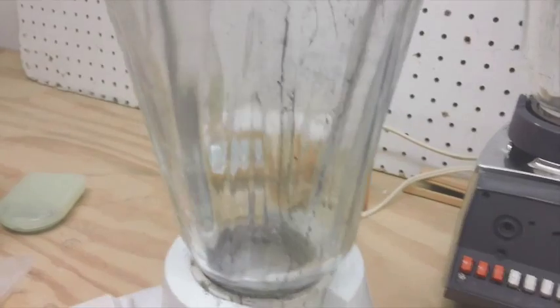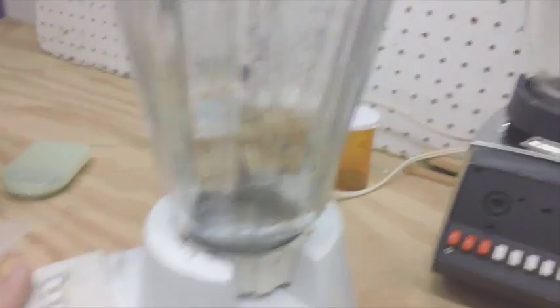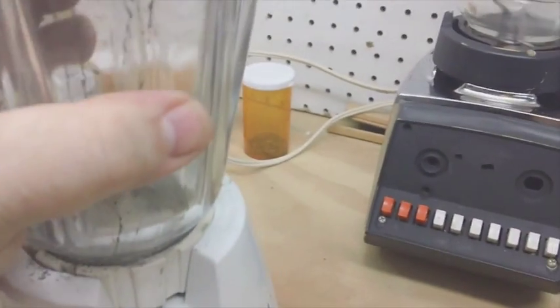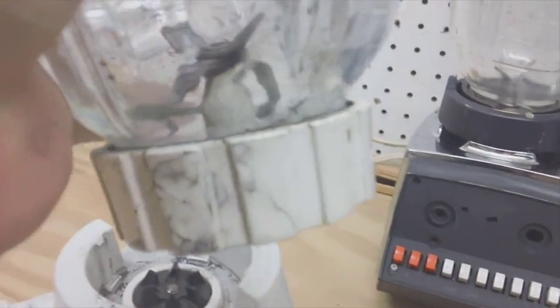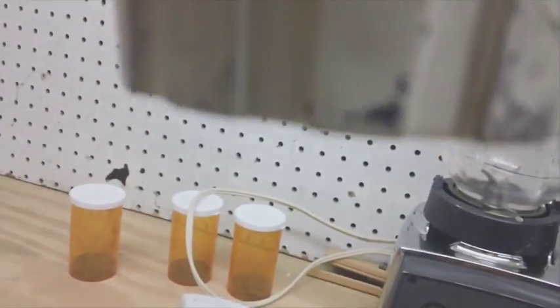If you look, let me take this off here. Right here on the bottom you can see this right here, acetone is leaking onto this and it's starting to crack and come apart. I bet it's made out of some type of PVC which acetone will destroy, so eventually this will get to the point where this is completely useless to me.